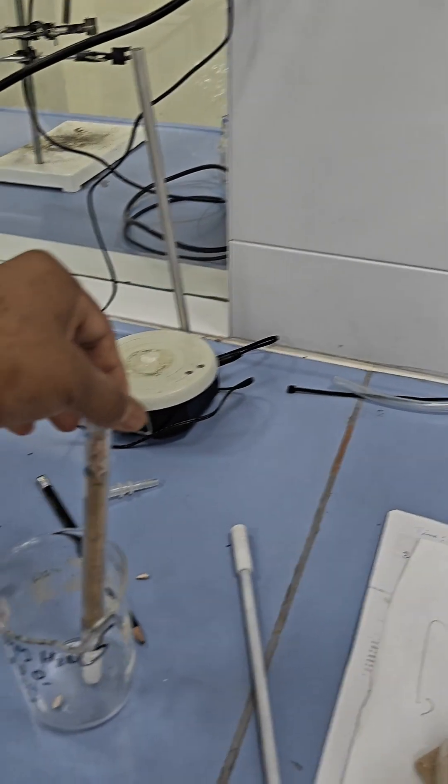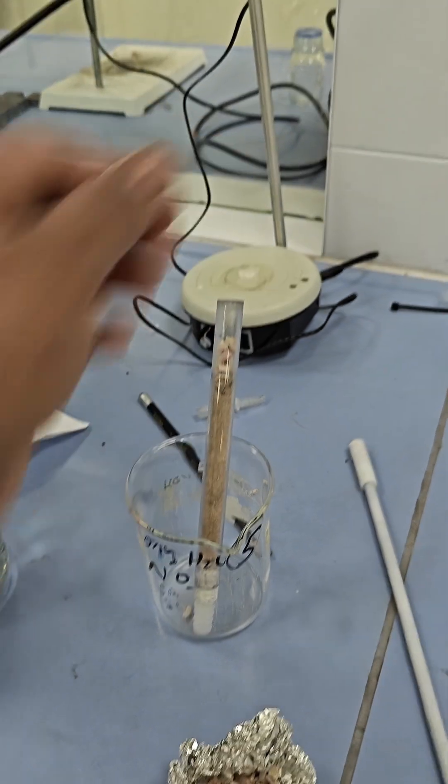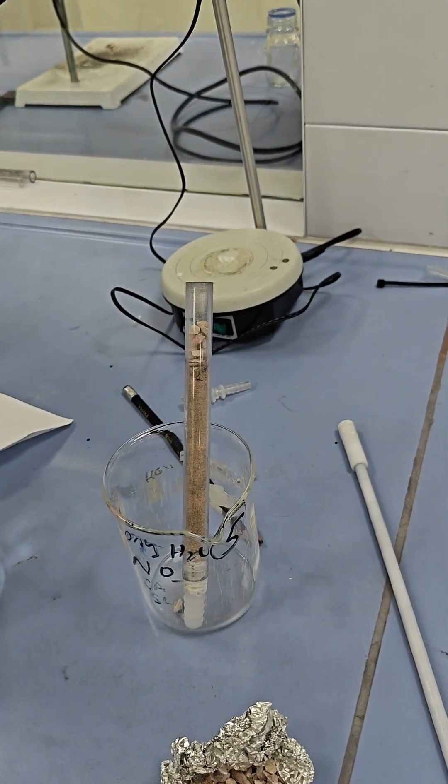Now this is ready for filtration. So this is all about loading the materials into the adsorption column or the filtration column.